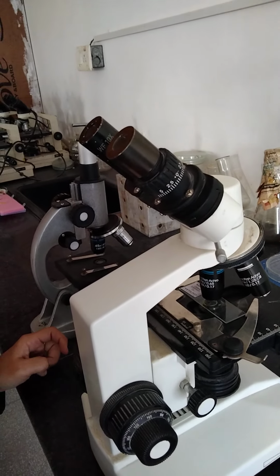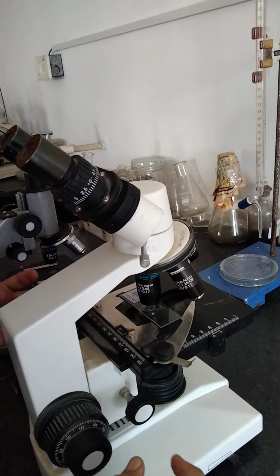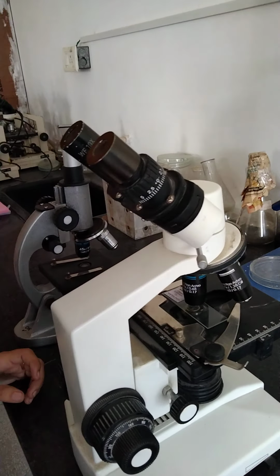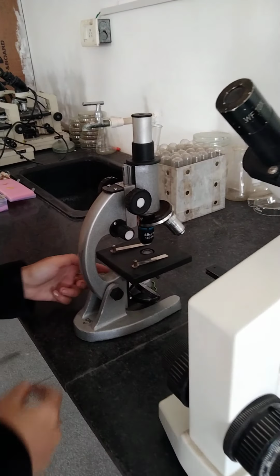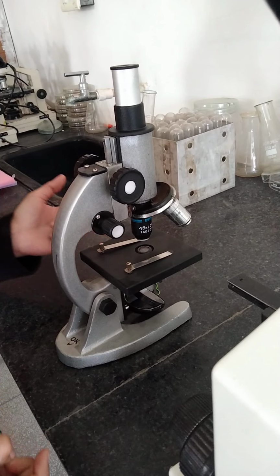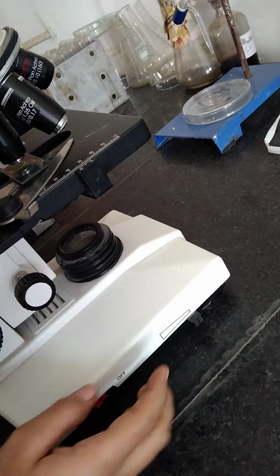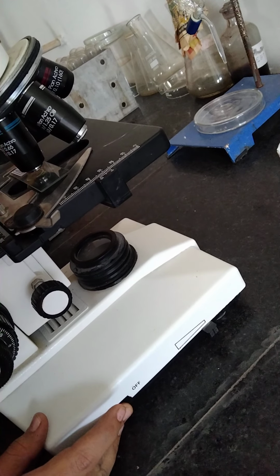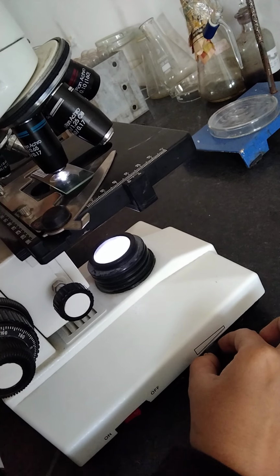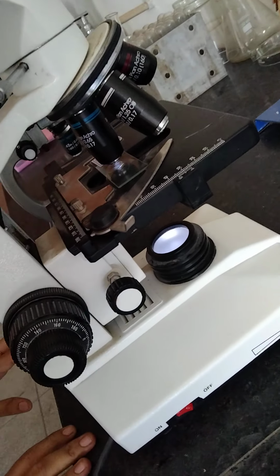Okay, then next one, clips. Clips are removable stage clips or spring clips which hold the slide in its place. Exactly. Then mirror. It is a light reflecting device, as you can see here. It is used to concentrate the light in the condenser. But nowadays the concept of the mirror has been depleting, and there is the concept of artificial illumination, for which you can use a light, an LED kind of thing, and this is the regulator for increasing and decreasing the intensity as per your requirement.